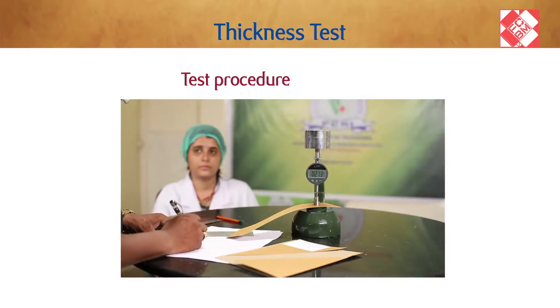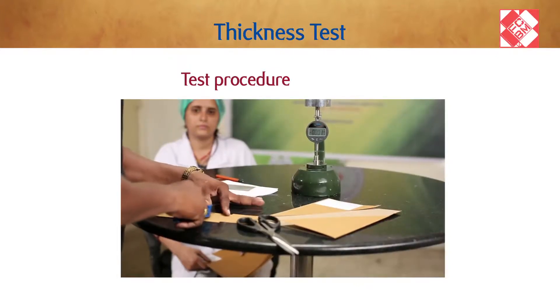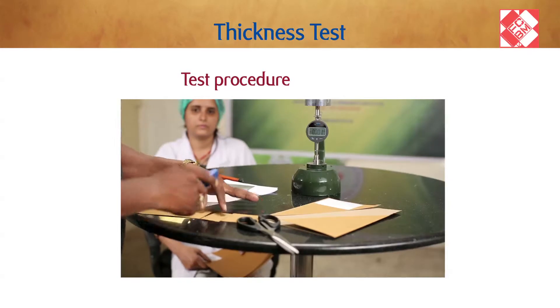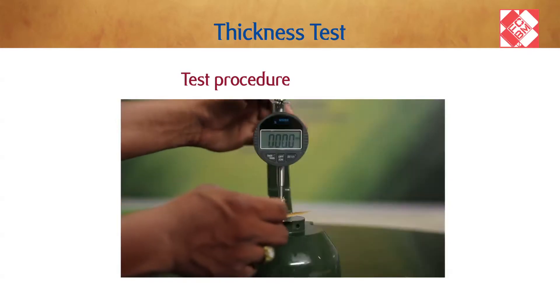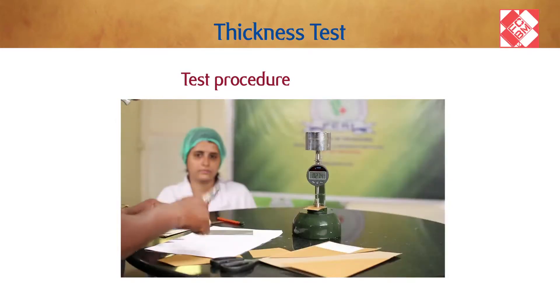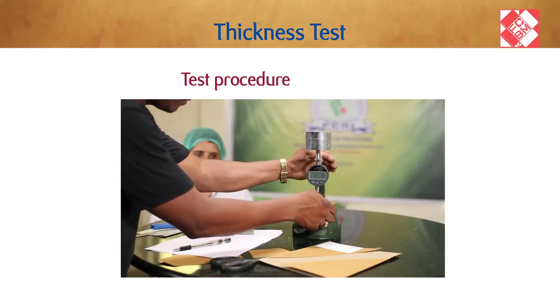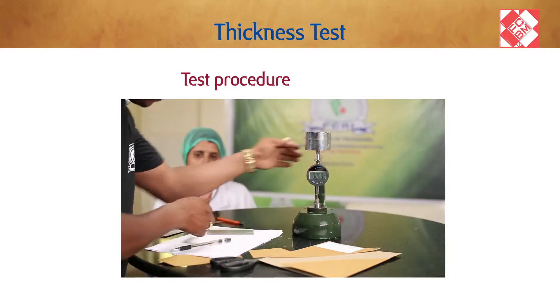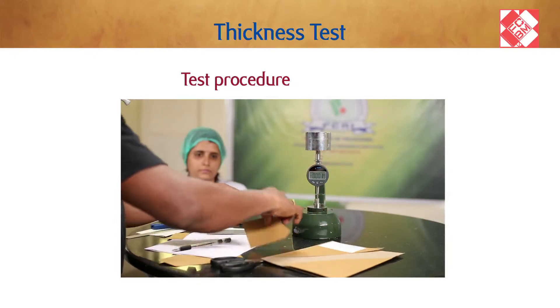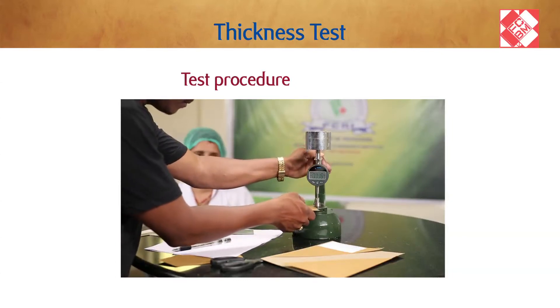The micrometer should display the thickness reading after the dead weight pressure has been applied to the specimen for a dwell time of two to five seconds. Take at least 10 readings and calculate the mean value to obtain the average thickness of a single specimen of paper or board.